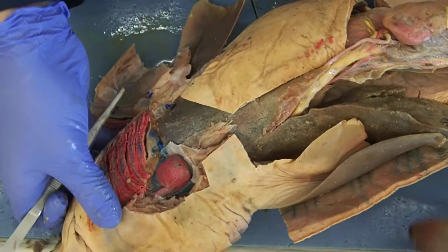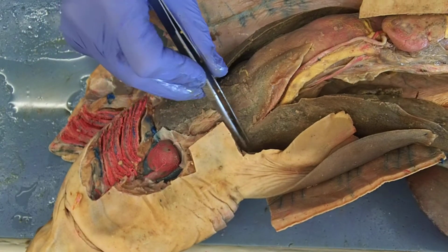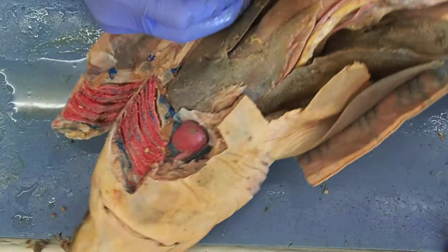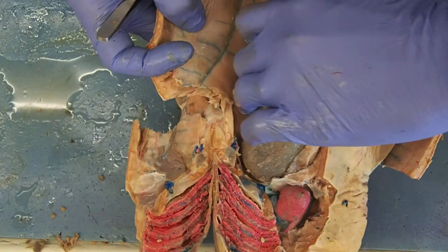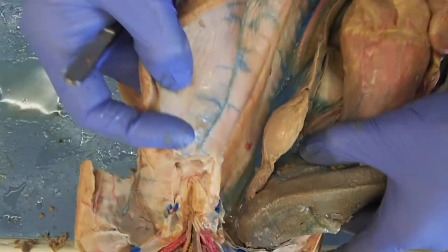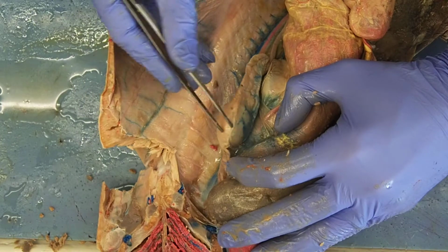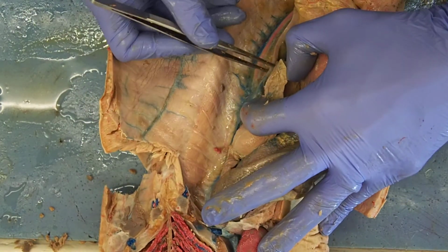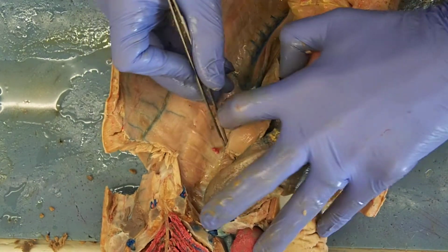Let's move up a little bit. Those oviducts travel up and they go behind or dorsal to my liver. And I think the best way to show this is if I move some things around here. We lift up this lobe. When we do that, this structure, this is my ovary. But if I move that away, here's the oviduct behind it.